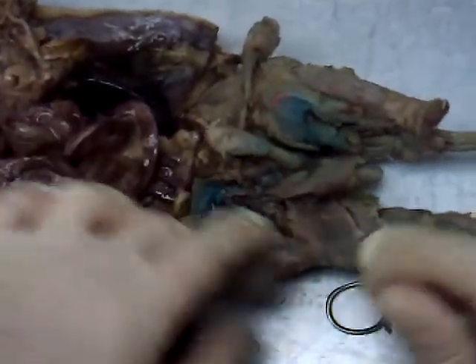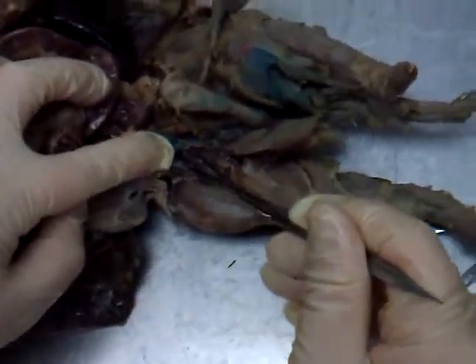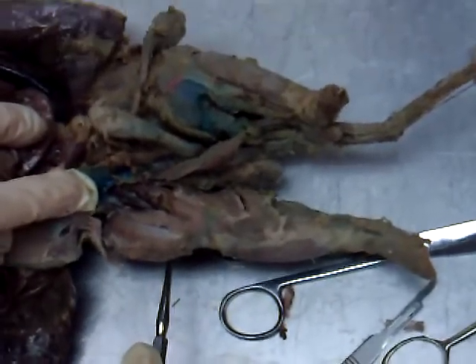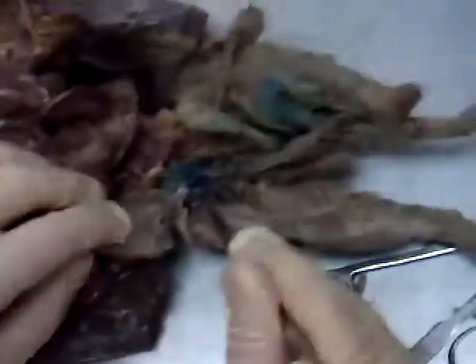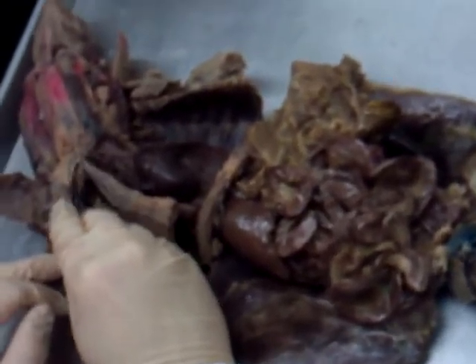One last thing also to find here on the thigh. You may see a nerve down here in the mink's thigh region — that would be the mink's femoral nerve. The big nerve found on the back is the sciatic nerve. So don't forget some of the nerves: we had the vagus nerve up here, femoral nerve on the front, sciatic nerve on the back, and the brachial plexus in the mink's underarm.